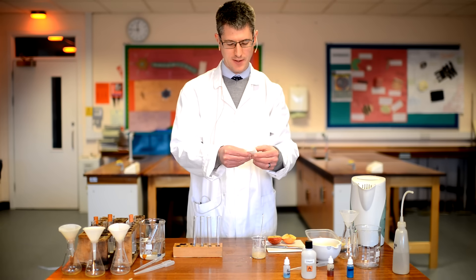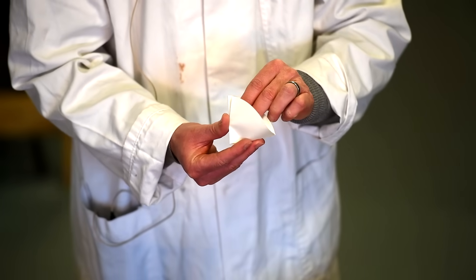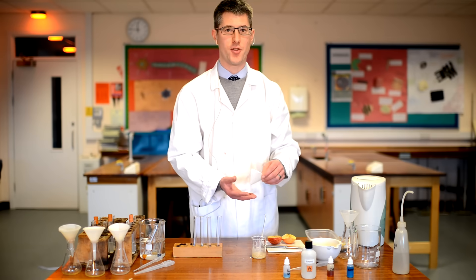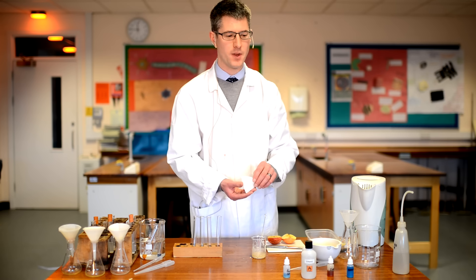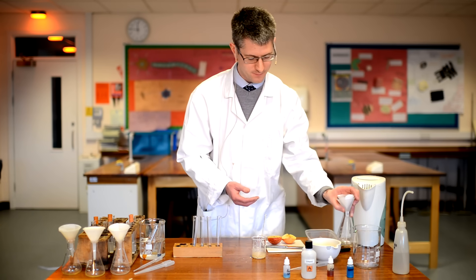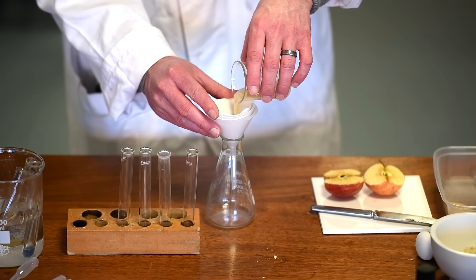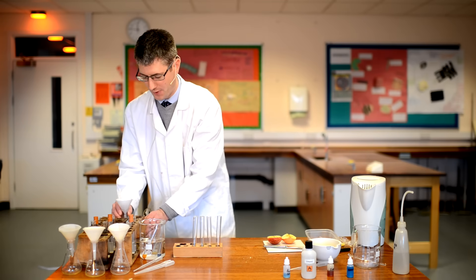The reason we filter is that food tests are subjective — you are looking for a colour change that you have to decide if it has occurred or not. The food itself can be coloured or can produce cloudy suspensions, which could make it much harder to see the colour change you are looking for. So the idea of filtering is to remove as much of the solid food as we can to help us more clearly distinguish the colour changes we are going to see. So we're going to filter the food — in goes the biscuit and distilled water — and that takes some time, so I'll put that to one side.